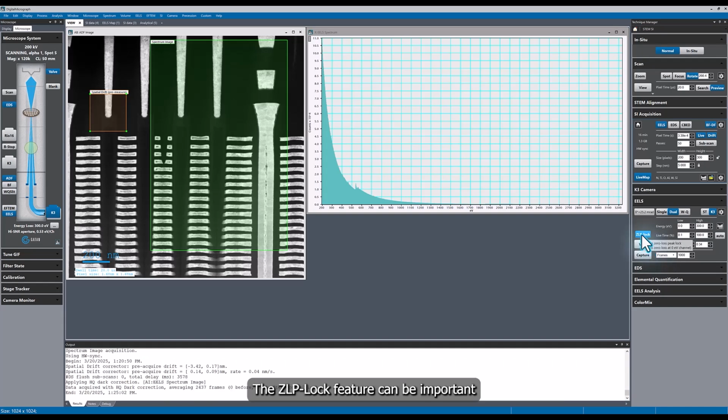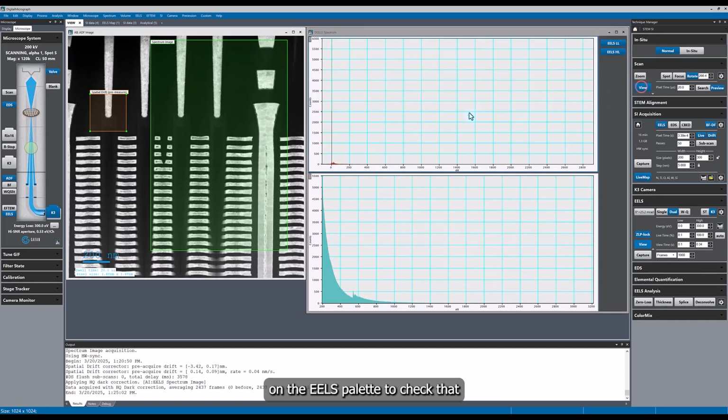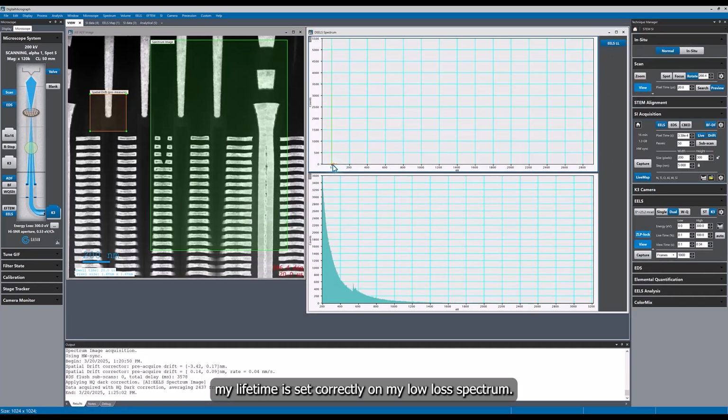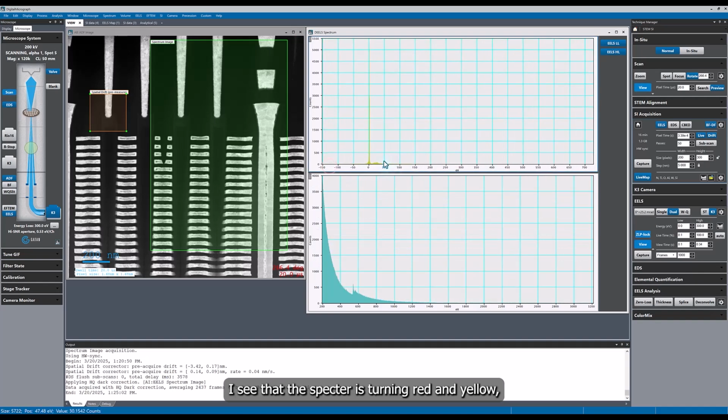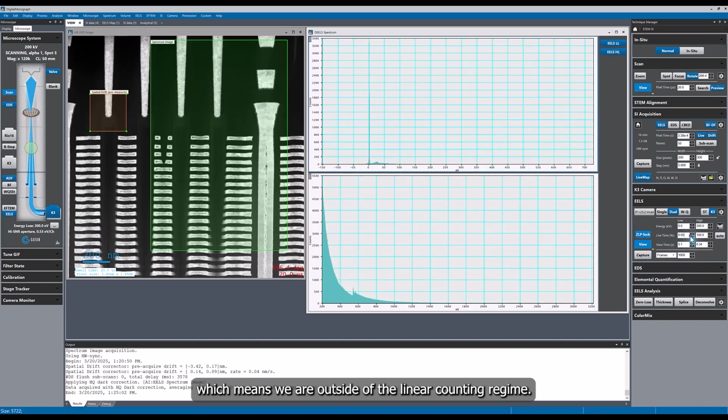The ZLP lock feature can be important when acquiring multipass data, especially if there are any stray fields in the room or if the operator is sitting next to the microscope and happens to move their chair during the acquisition. Next, I'm going to select View on the EELS palette to check that my live time is set correctly on my low loss spectrum. I see that the spectrum is turning red and yellow, which means we are outside of the linear counting regime.